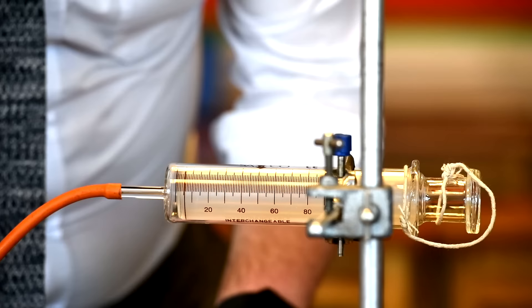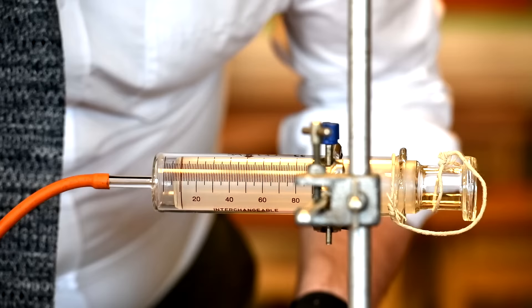The gas syringe needs to be kept dry at all times, otherwise there's a risk of the plunger getting stuck and you won't be able to get any results.